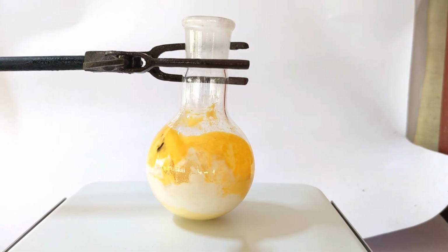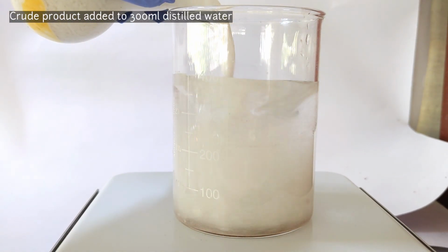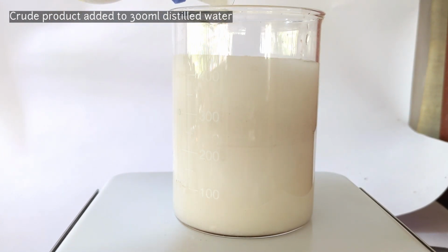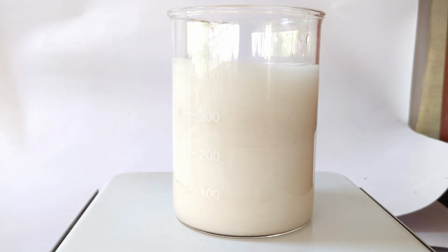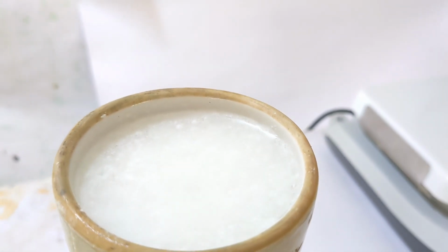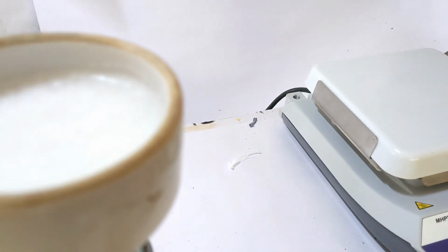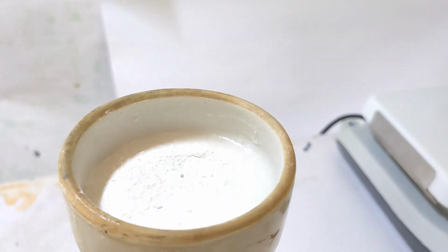Finally, we have the white precipitate of the crude product 2,4,6-tribromoaniline. It was then transferred to 300 ml distilled water. This will help remove the side products and unreacted aniline and acetic acid. The precipitate was then vacuum filtered to obtain the crude product, which was then washed in the funnel itself with distilled water to remove the side products.